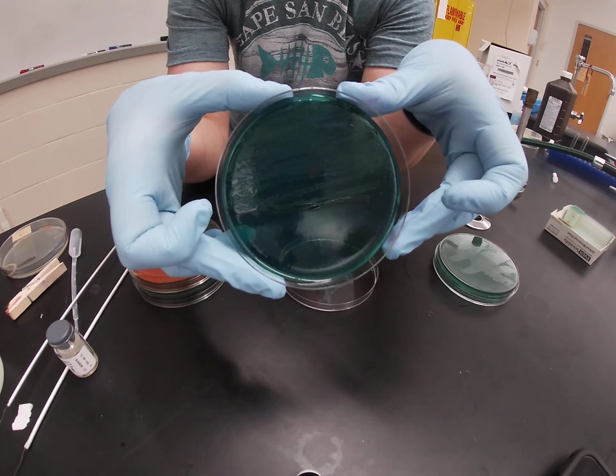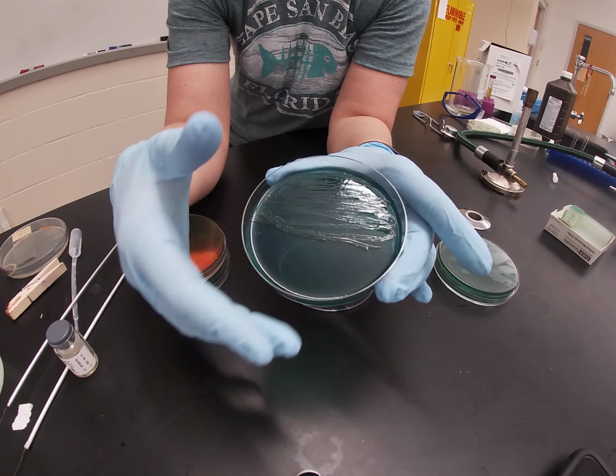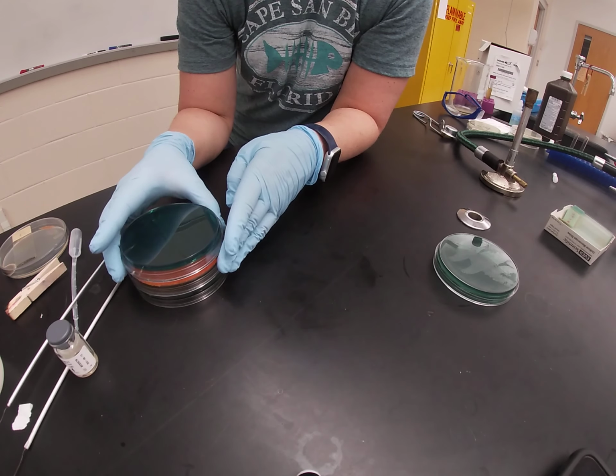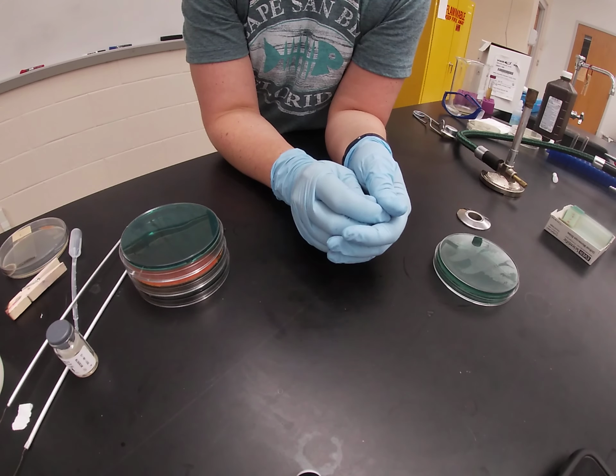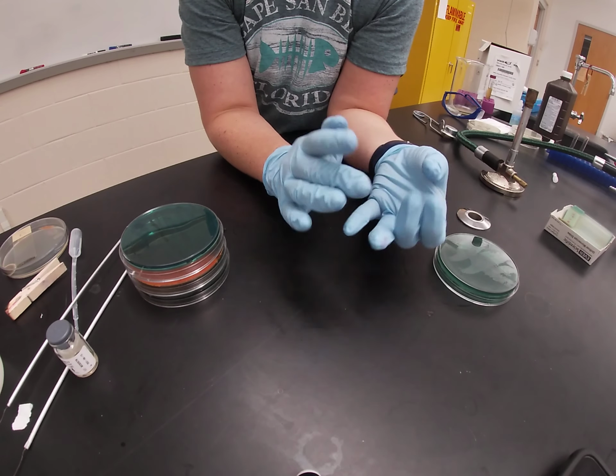So when these organisms grow on this plate, you will often see some black associated with the growth. So that is a sign of hydrogen sulfide gas production. Some organisms are able to ferment sugars and produce H2S, others just one of the 2.